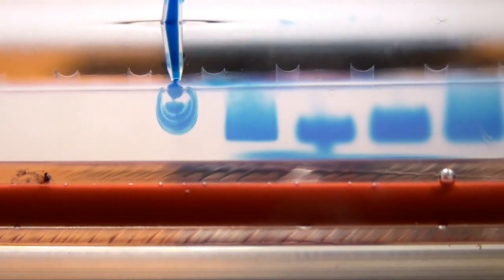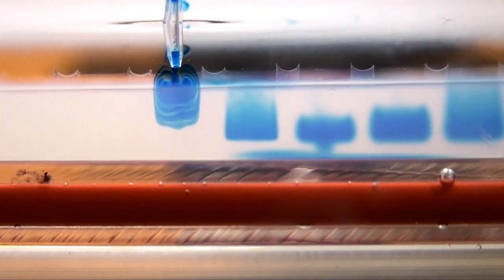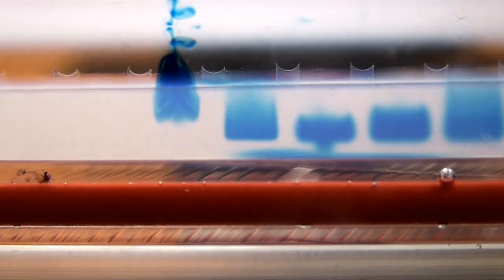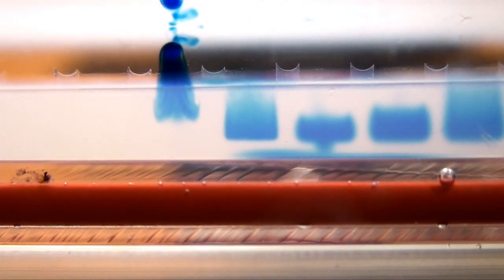Sometimes when you are in a big hurry purifying your DNA, you will leave a little bit of ethanol over your pellet and then dissolve it in your appropriate buffer, usually TE buffer. If there is too much ethanol or isopropanol or some organic solvent, when you load your gel, you'll notice your sample float out of the well into the buffer. Here is a video showing that.